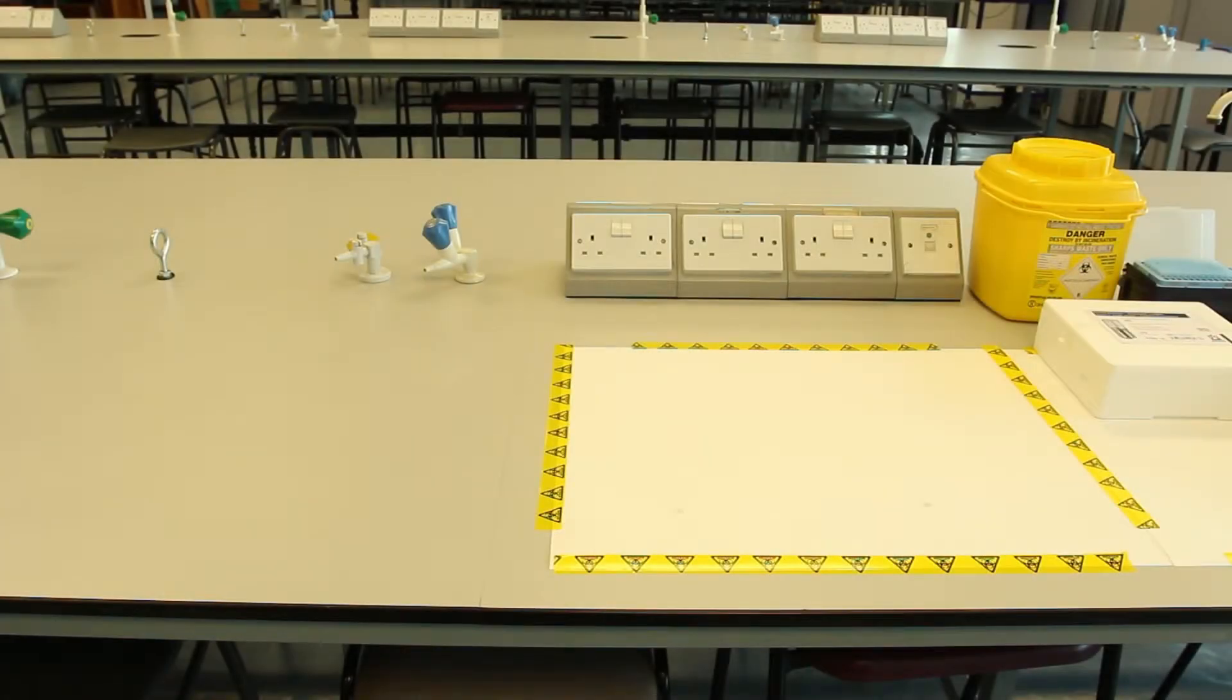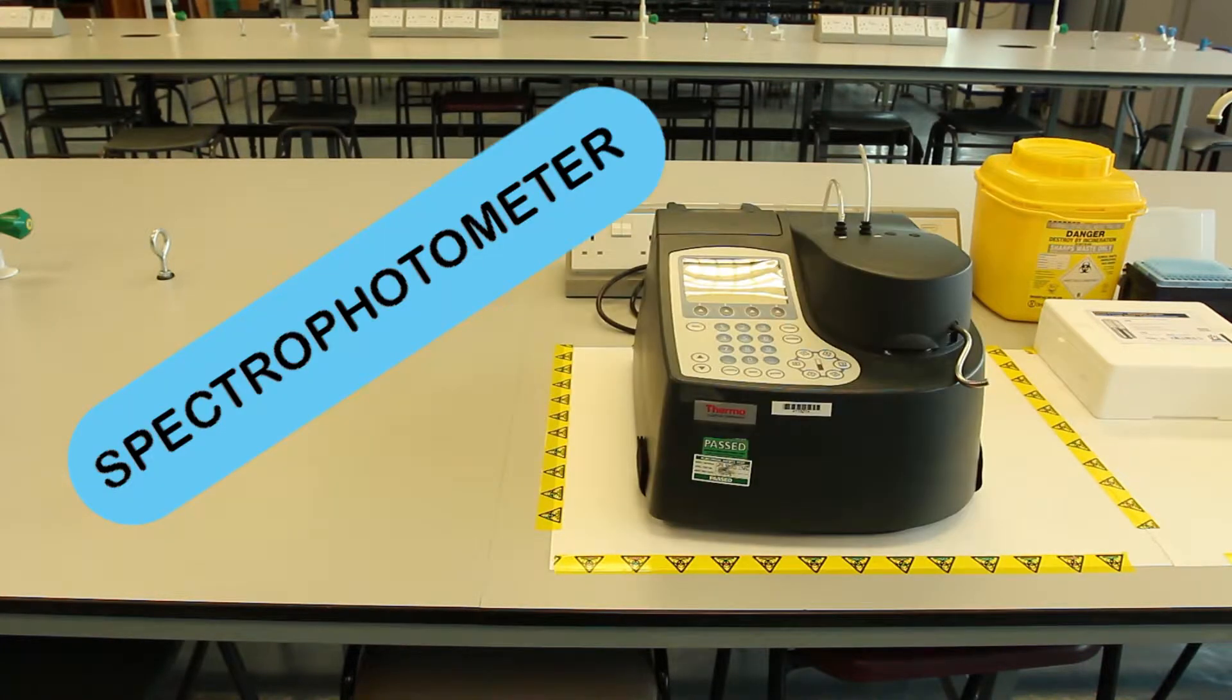Hello. In this video we'll be looking at how to set up and use a spectrophotometer.